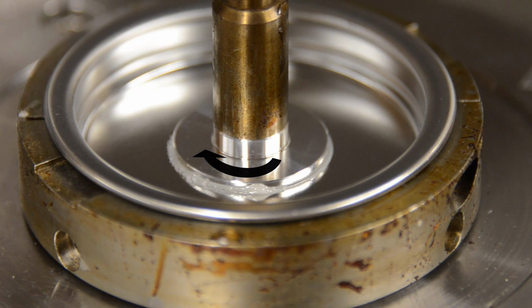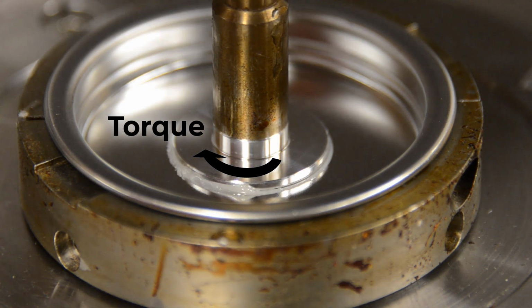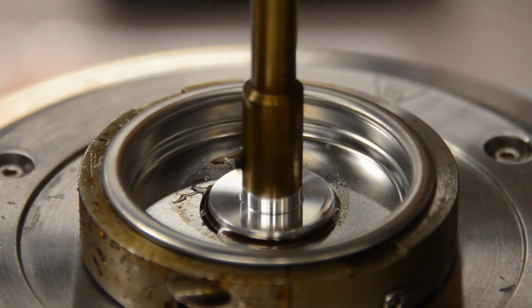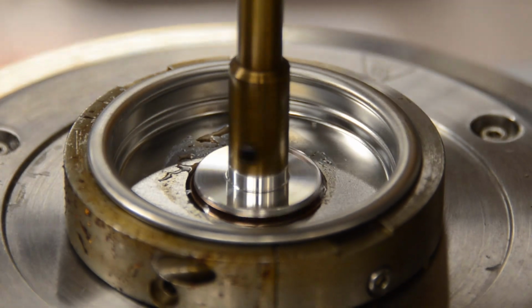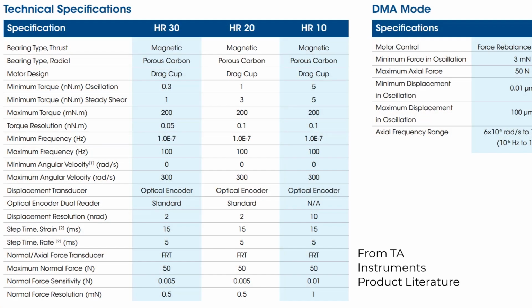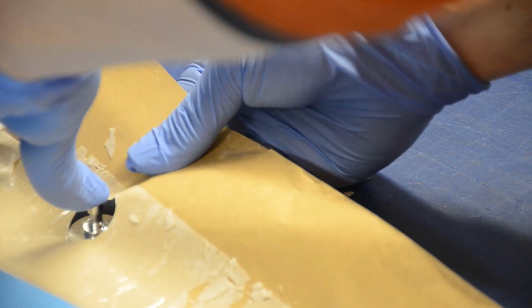We will also set a torque value that the rheometer will maintain on the sample. If we had set a relatively high shear rate like we did for the previous liquid resin test, the rheometer would not be able to produce enough torque to twist the resin film at the programmed rate. Another way the test could be conducted is with a relatively low shear rate that requires a torque value small enough for the rheometer to produce even at room temperature when the resin has very high viscosity. The sample is loaded and the test is programmed.